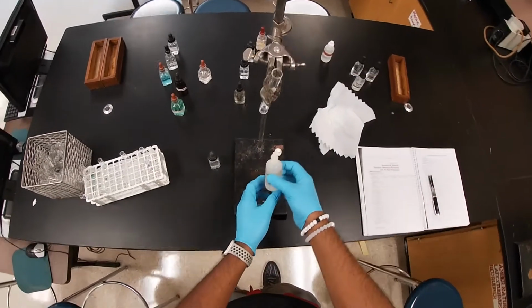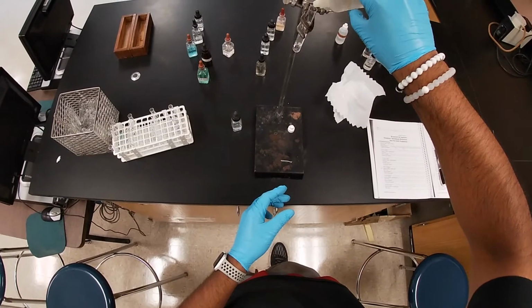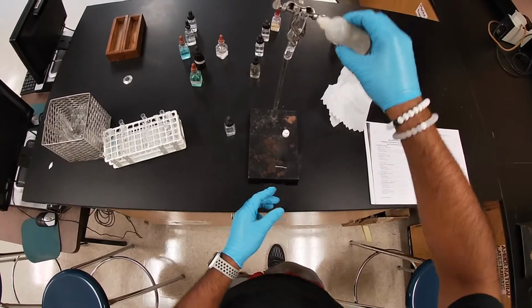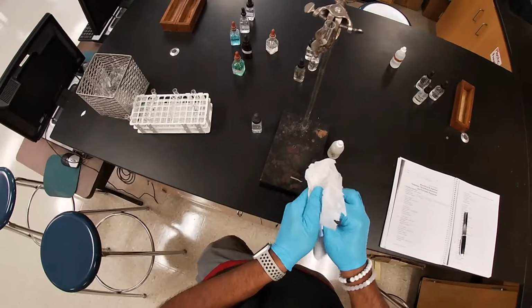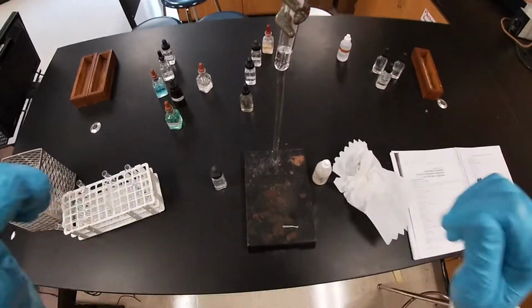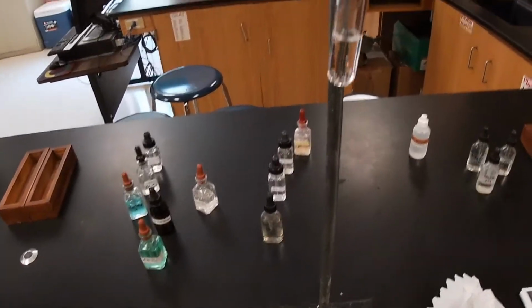If you notice, the first thing that starts happening is we start forming gases. We start seeing some bubbles. Let me add some more. You do start forming some gas formation, some bubbles. Hopefully you can see we do have some bubbles. Let me take it off real quick so I can zoom it in for you.